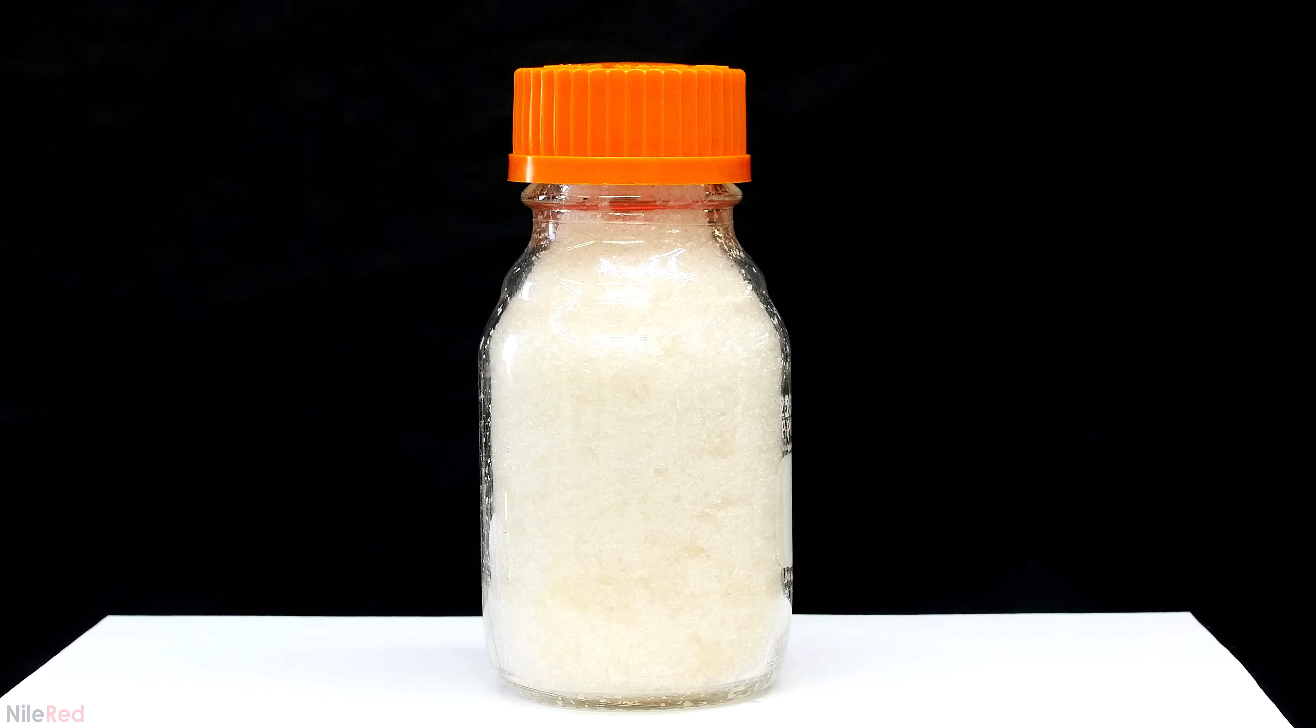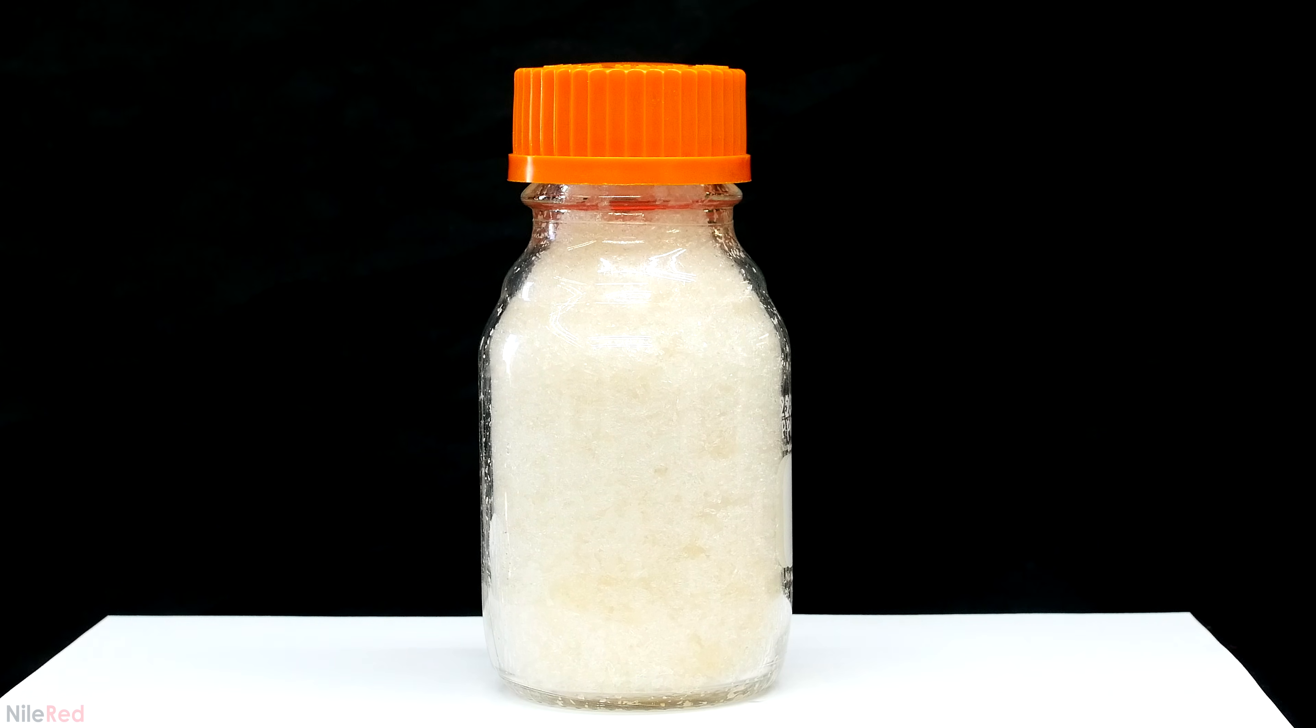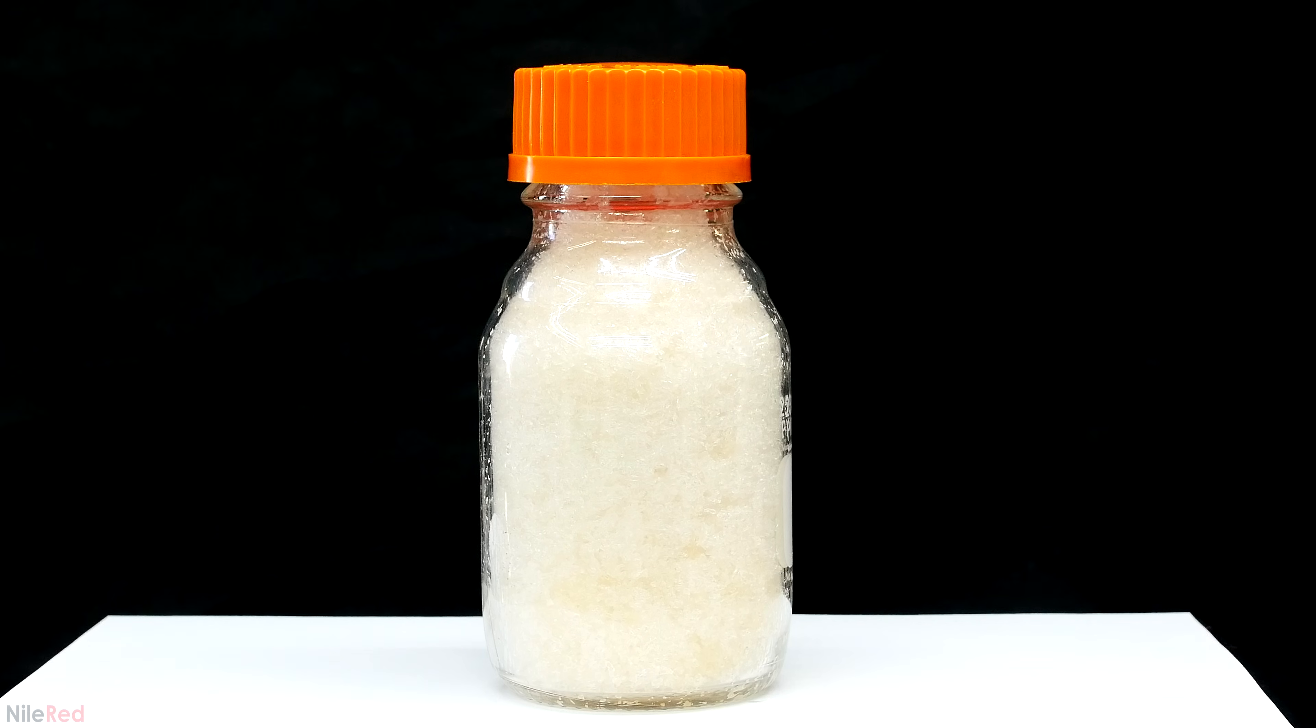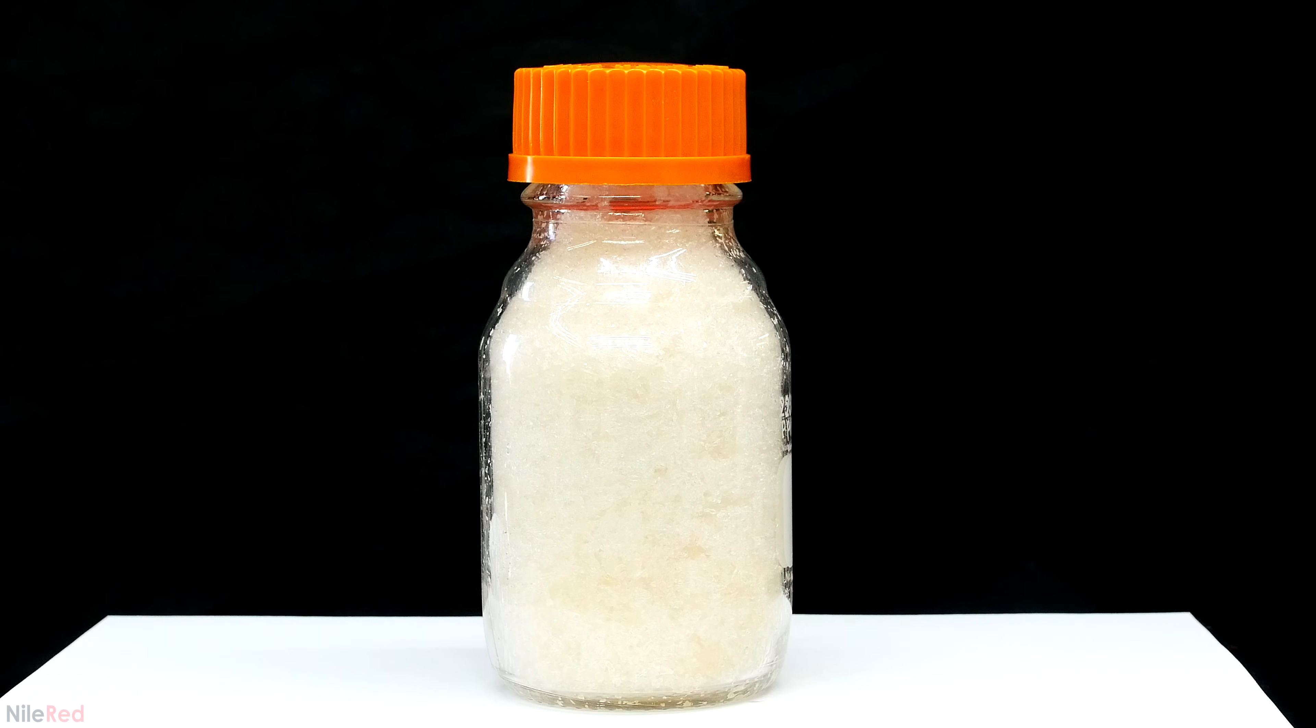Our final phenol product is an off-white crystalline solid. Pure phenol is as white as the paper below the jar, but unfortunately the contaminants make it a little bit yellow. I did consider redistilling everything to clean up the phenol, but I decided that it really just wasn't worth it. The amount of contamination is extremely low compared to the crude stuff that we started with, and for what I'm using it for, it really shouldn't have much of an impact.